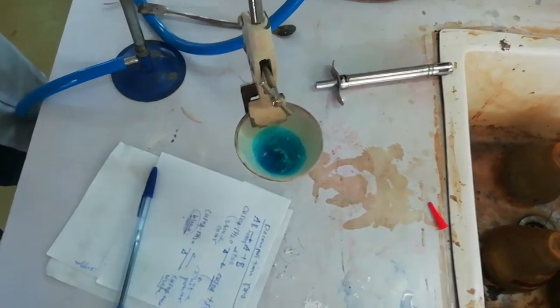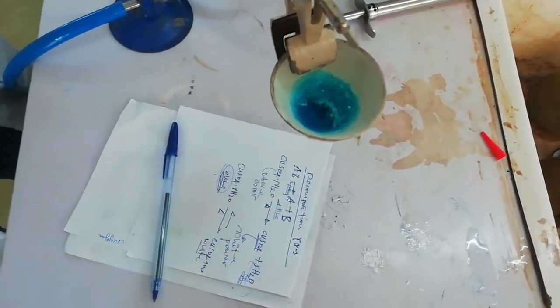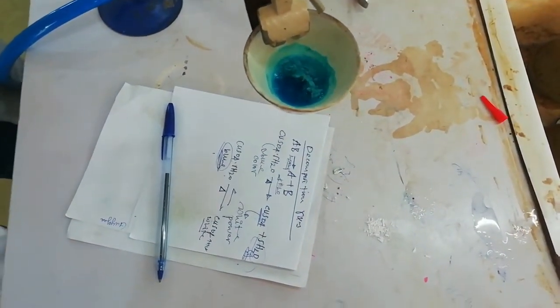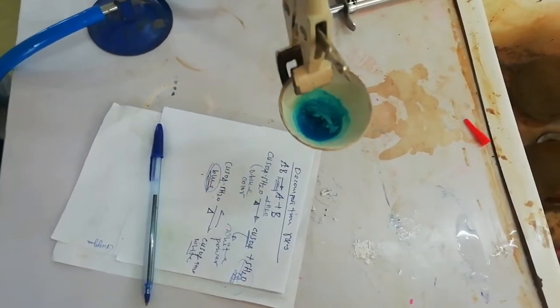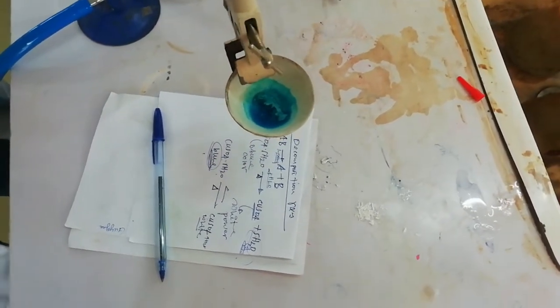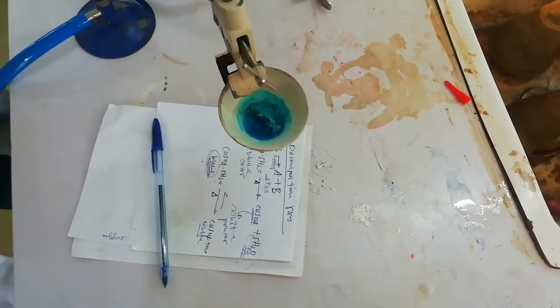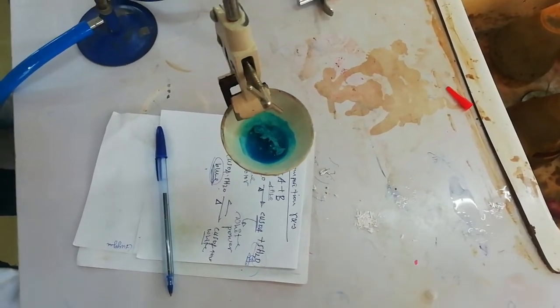This indicates that the decomposition reaction of copper sulfate pentahydrate is a completely reversible reaction. It was blue and it returns back to blue color.